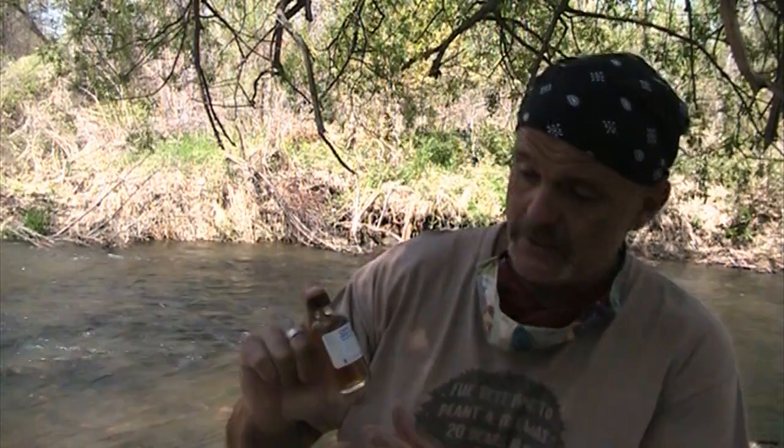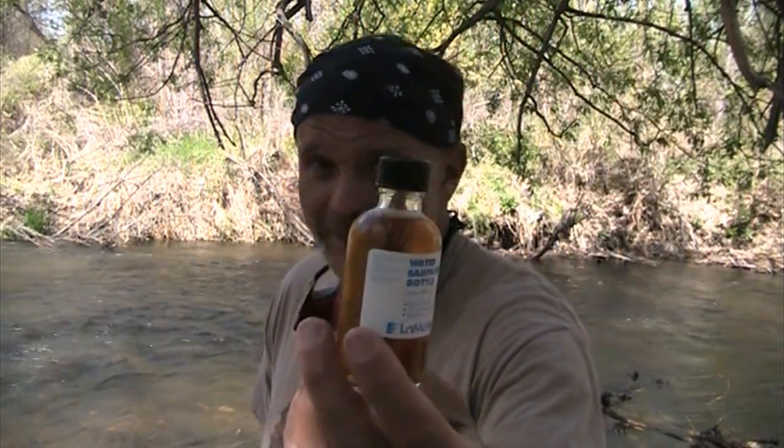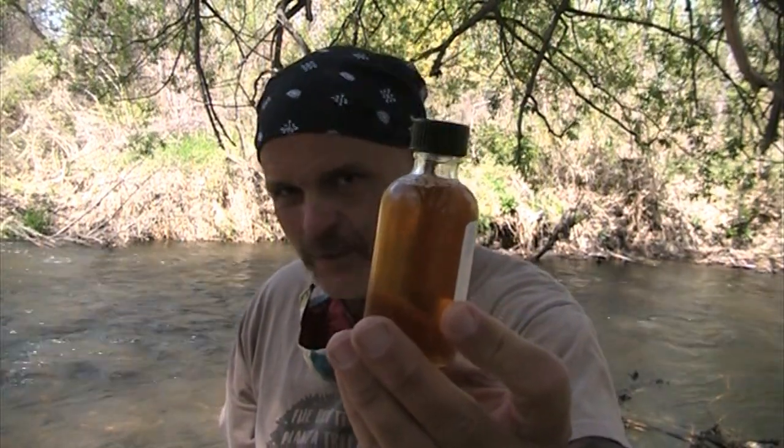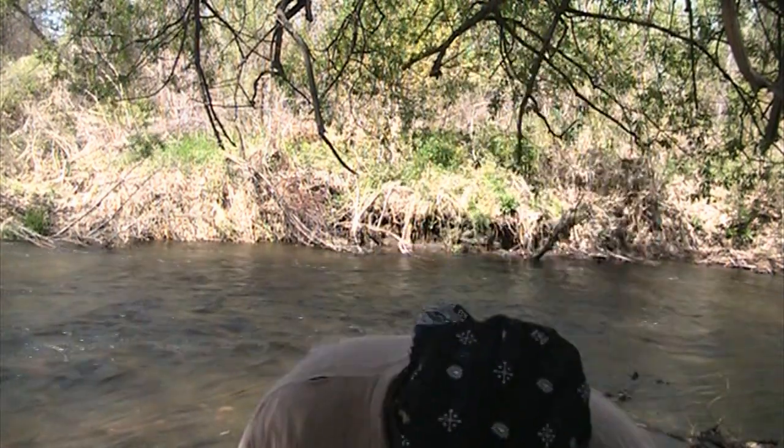You can tell them, shake it like a Polaroid picture. If they like Outkast, you just got to shake it. Cool thing to note is the darker this is, the more it looks like a nice dark heavy beer, the higher your dissolved oxygen. But now, we have to actually titrate.